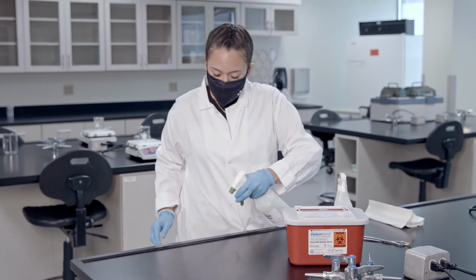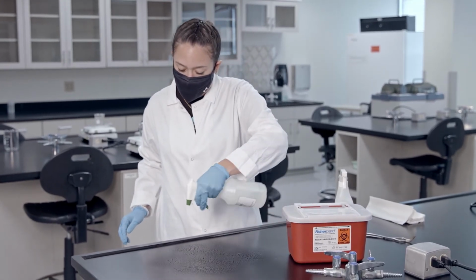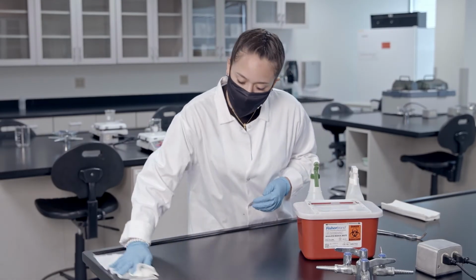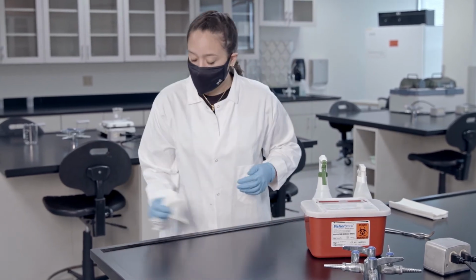Spray the area with freshly made 10% bleach and allow to air dry for 15 minutes. The bleach solution must be made fresh because diluted bleach is no longer effective after 24 hours. Following the 15-minute contact time, wipe the area down with paper towels and again with disinfectant.